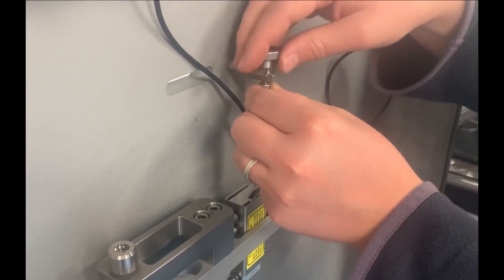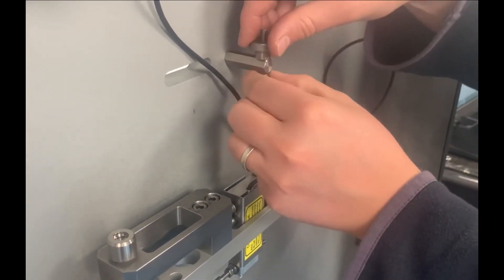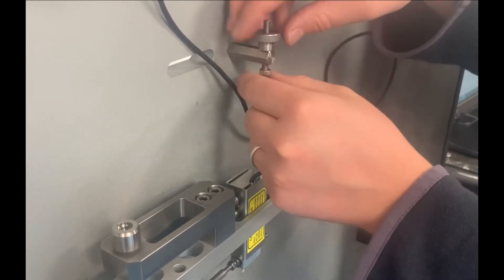Adjust the spring tension to lift the specimen just out of contact with the test wheel.